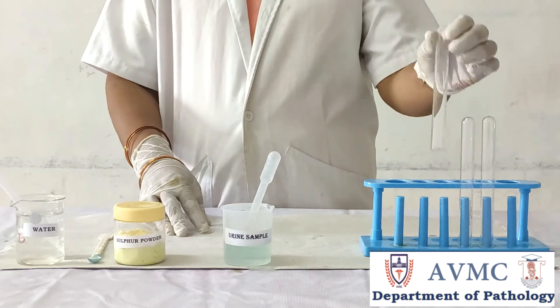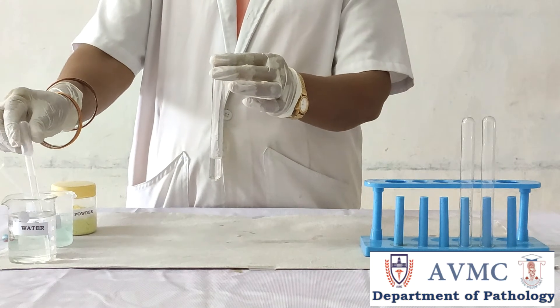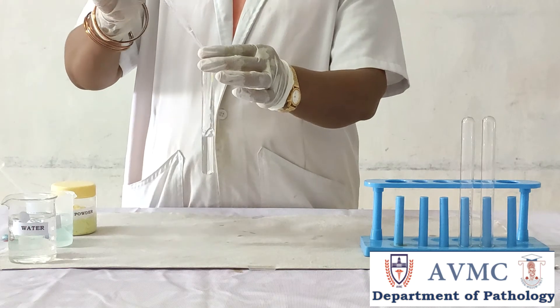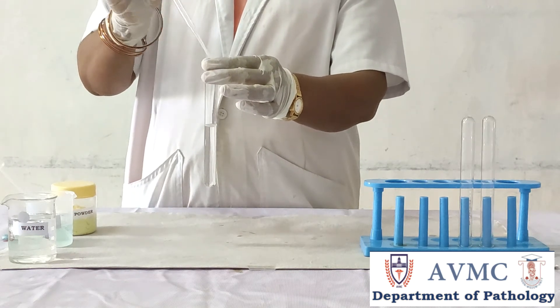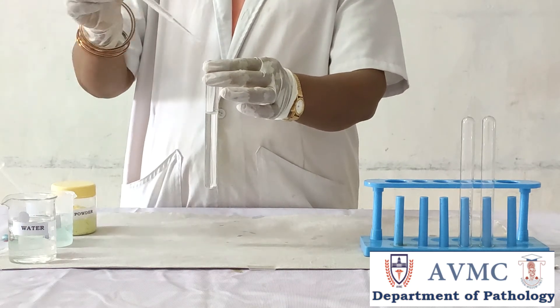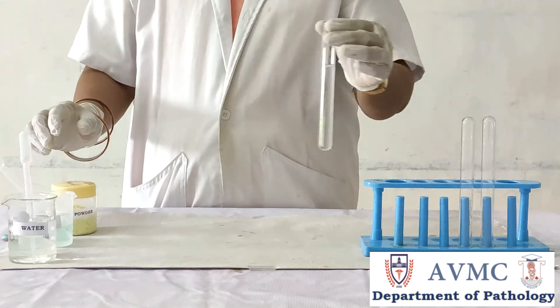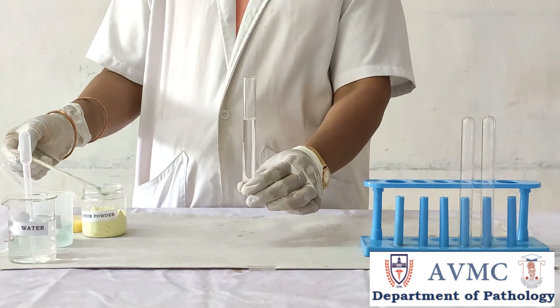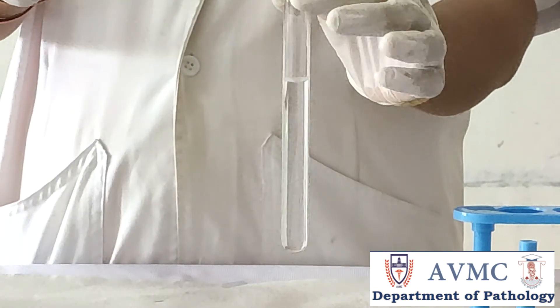Procedure: take a test tube and add two-thirds of water in it. Then add a pinch of sulphur powder into it. The sulphur powder floats over the water, and so it acts as a control.